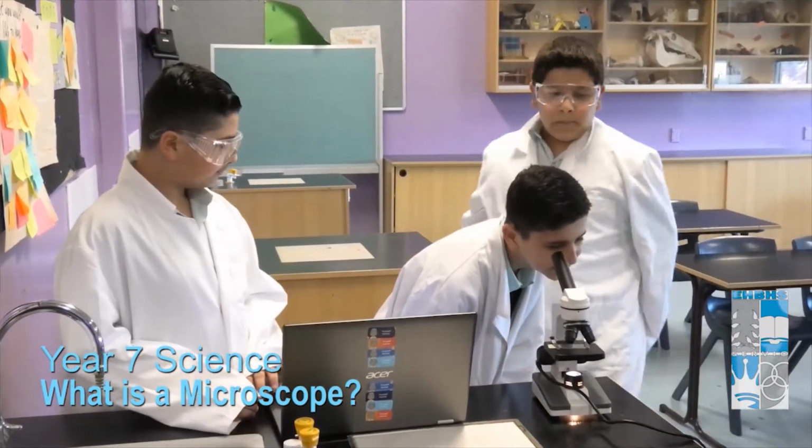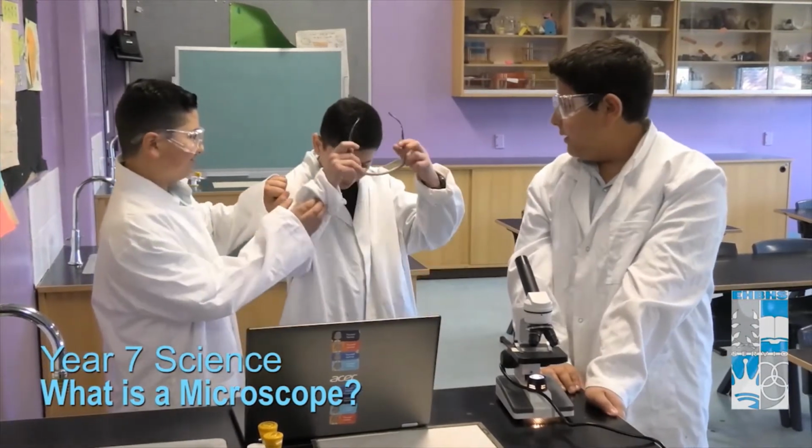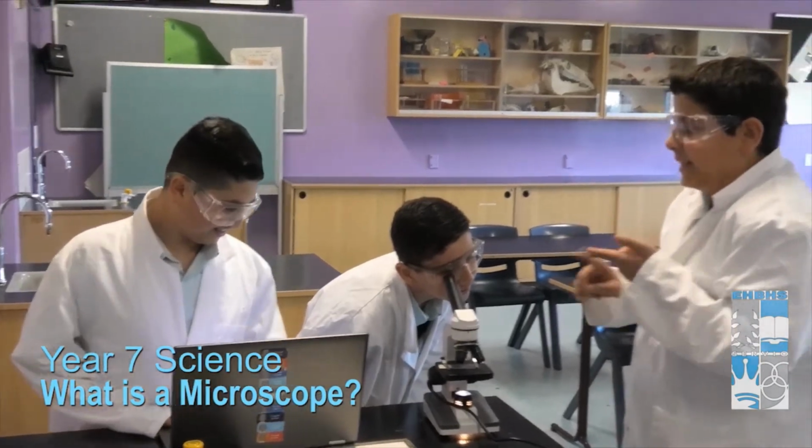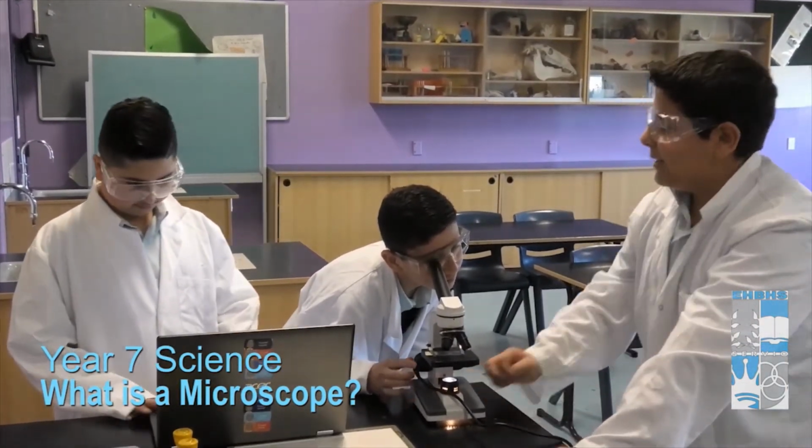Right now we can see the microscope view, and we can see little hairs as well. Look, as you can see, it doesn't show only a little blood from the cat paw. But because we zoomed in so much, you can see everything.